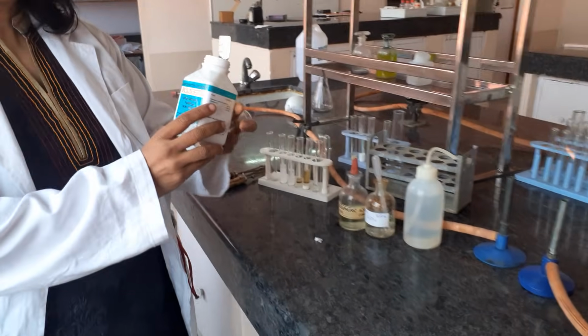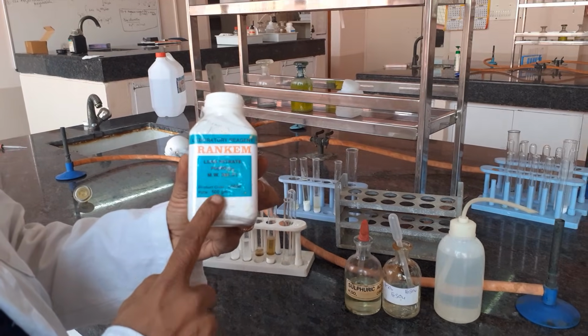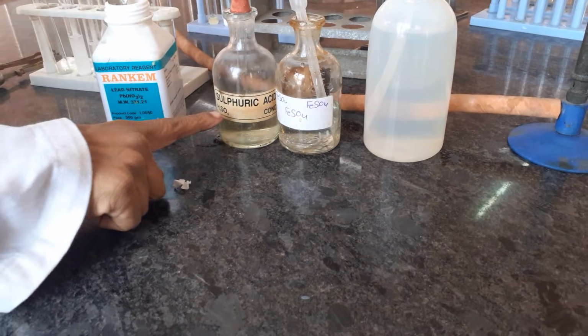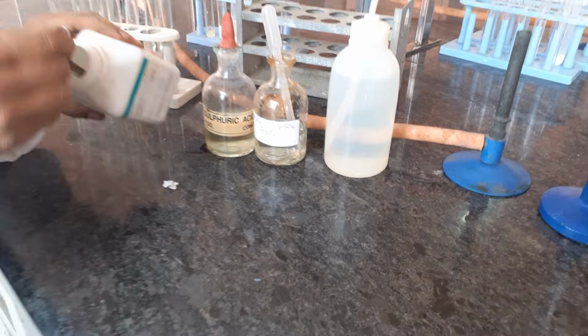So watch the other video of the brown ring test, which is for salts other than these. Whenever you have a cation of group 1 or group 5, there is a trouble. I am taking lead nitrate, that is a group 1 cation. I will require concentrated sulfuric acid and freshly prepared ferrous sulfate solution.